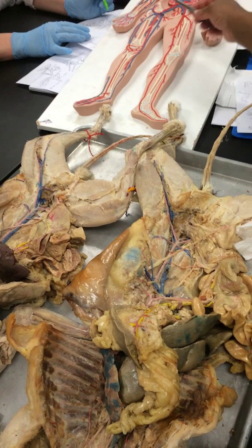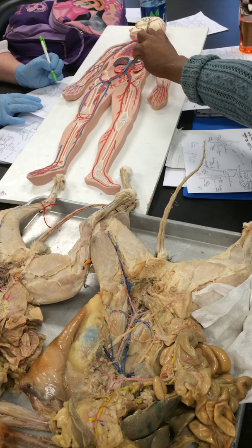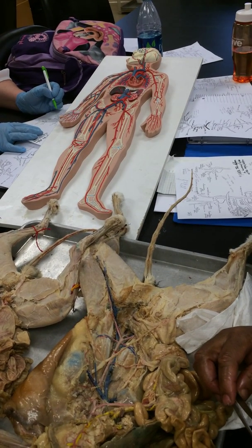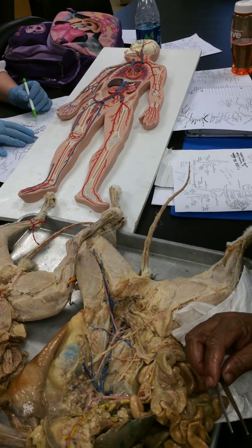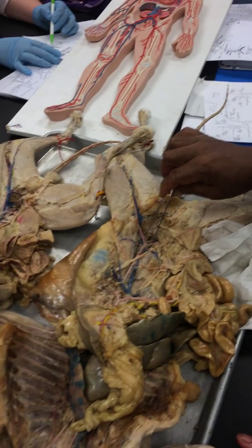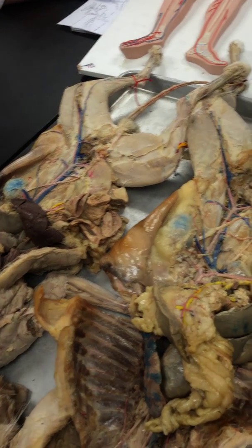In the human version, when it branches, see that? This portion looks just like the veins. You have an internal iliac going in, and then between this here and here is the common iliac. Now the cat doesn't have a common iliac. So this time you can really say the cat doesn't have one. The cat doesn't have a common iliac, instead it has an external iliac. Then for the cat, the abdominal aorta comes down and it branches a second time. So here is the second branch right there. And that's your internal iliac.